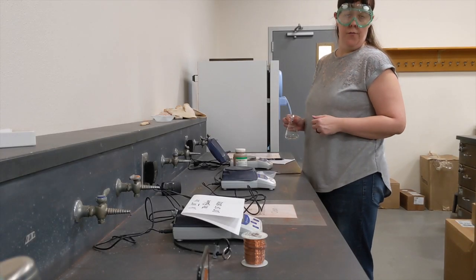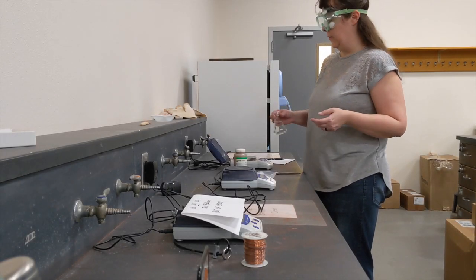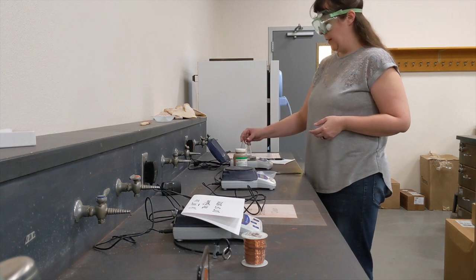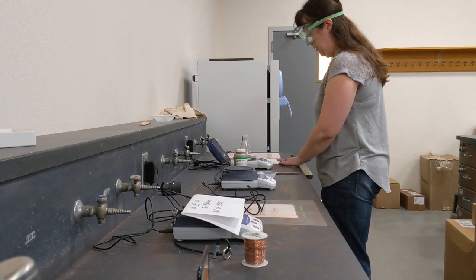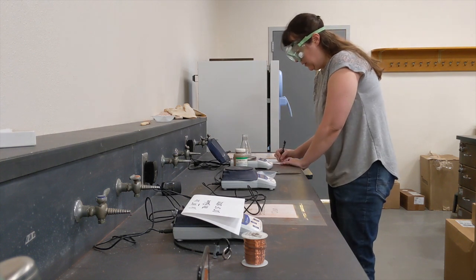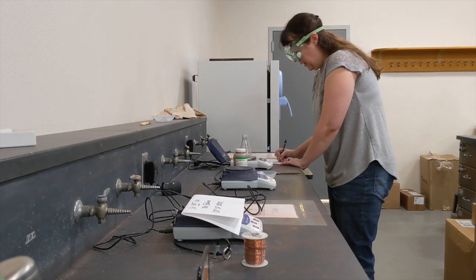To synthesize iron sulfate, we're going to need iron as one of our main ingredients. First thing I want to do is find the mass of my 125 milliliter Erlenmeyer flask. That mass is 69.77 grams.